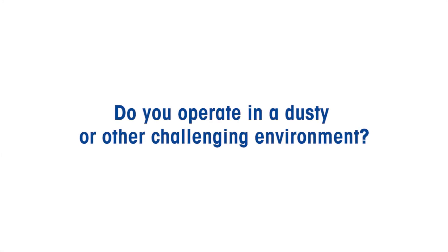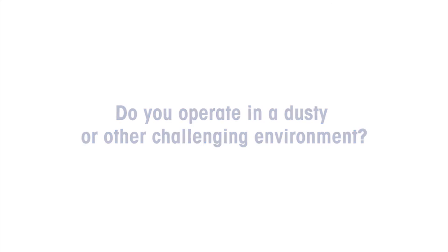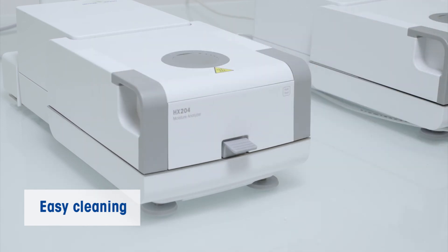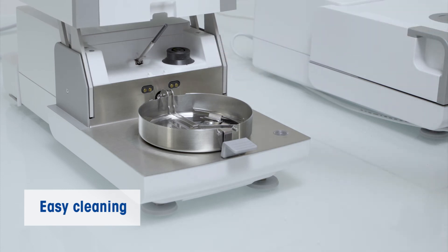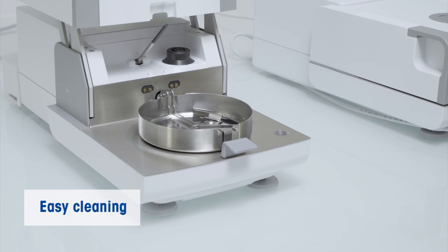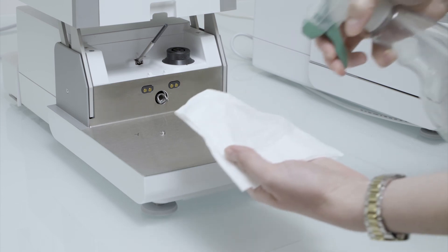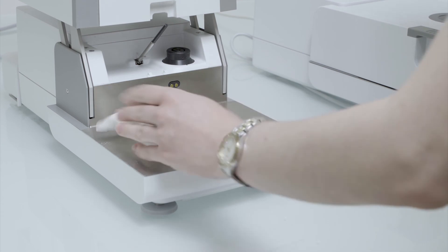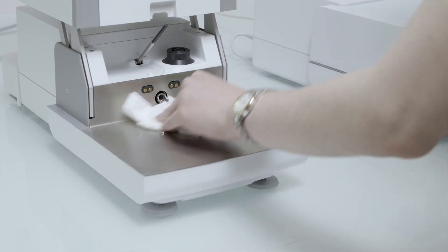Another question to ask is: do you operate in a dusty or other challenging environment? Frequent cleaning of the instrument is critical — the easier to clean, the better. A great example of design for cleaning is the hanging weighing pan of the HS153 and HX204 moisture analyzers. It can be removed easily, and the surface beneath it is flat and sealed, so there is no load cell opening. This eliminates the risk of weighing cell damage while cleaning and makes cleaning fast and easy.